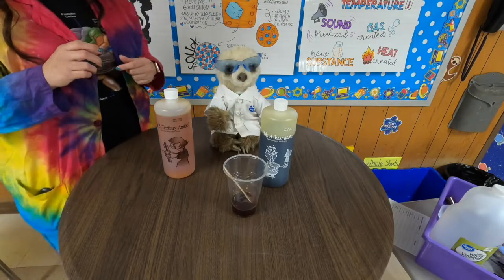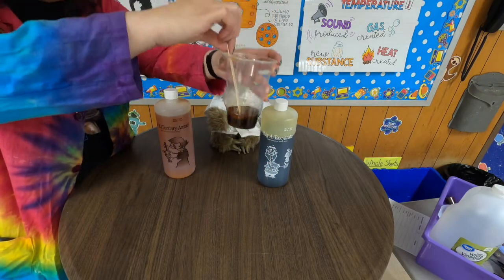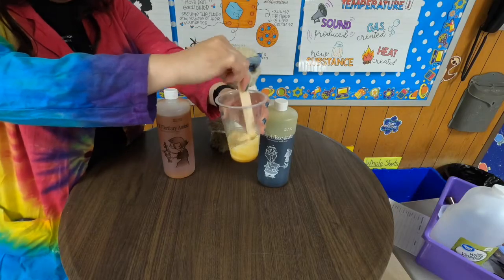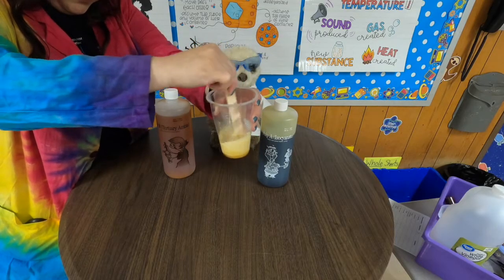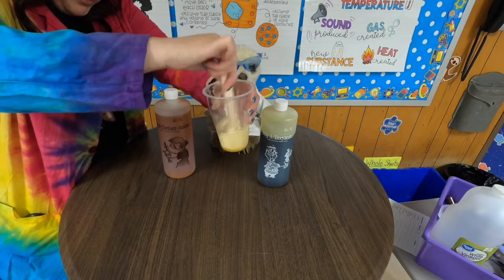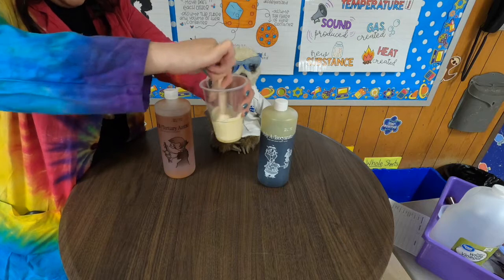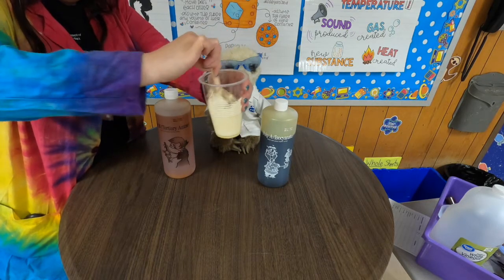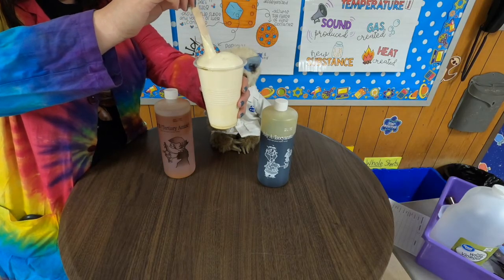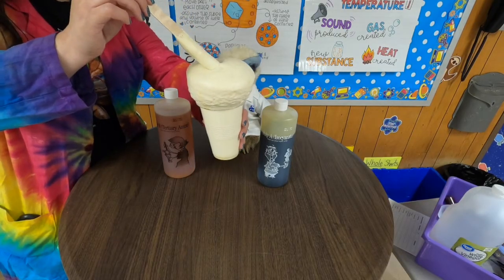So what I'm going to do now is mix them together. You'll notice that they're both in there. I put equal parts of each one, and now I'm going to start mixing. You have to mix very vigorously. Miss Bettis is here watching, recording with her camera, and she has never seen this reaction. You'll notice that something is happening now. And we definitely have more than what we had before. So this is the magic foam reaction.